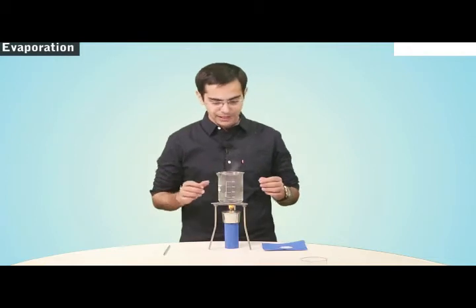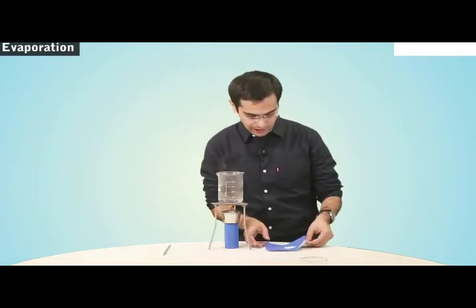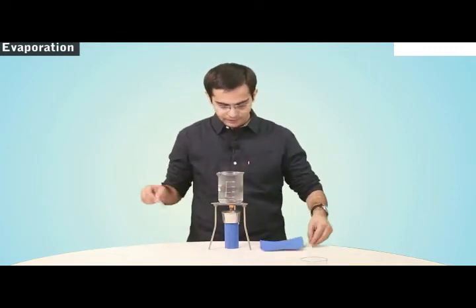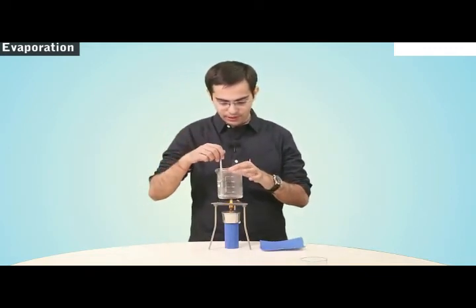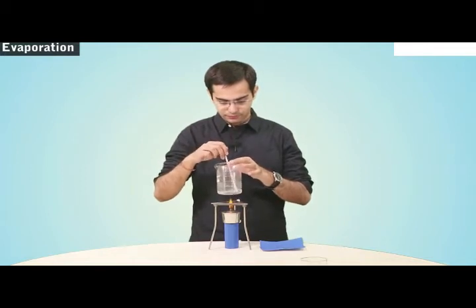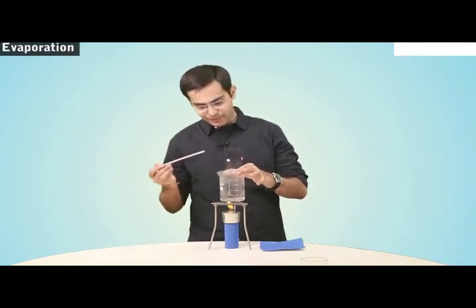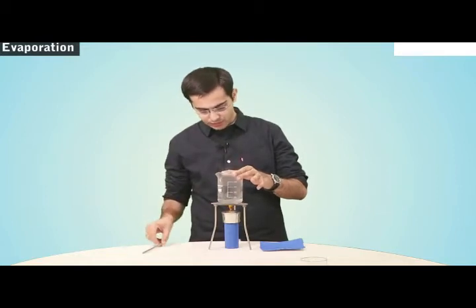So let's just first make a solution of salt. So here I add salt into this water and I'm going to make the salt solution. Alright, so we have made our salt solution right here.